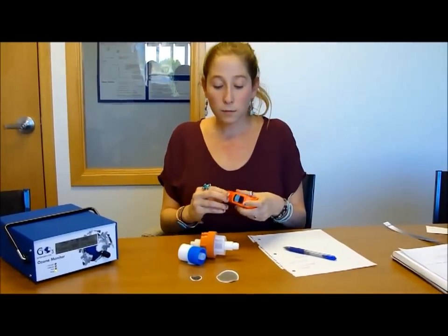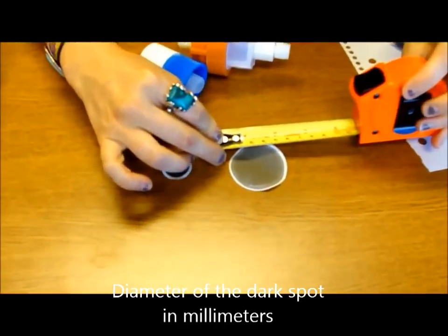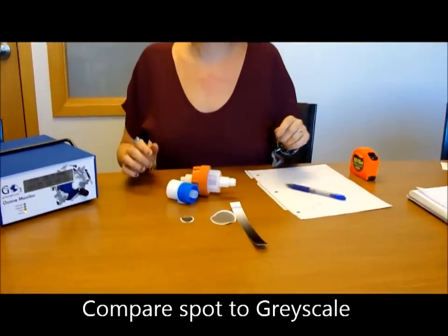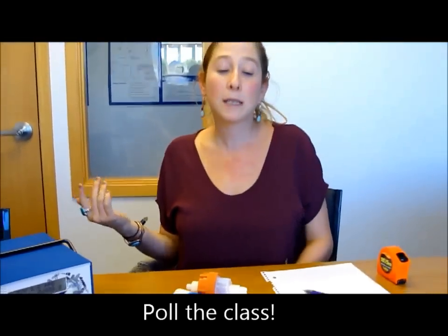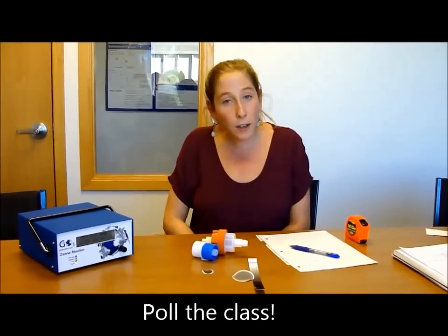You will also take the diameter of the spot, and you're going to measure that in millimeters, like so. Record that, and then the best part of all is you get to compare it to the gray scale. Now I suggest you take a poll with your class and get everybody's opinion about what the value is, and then you can take the average of those values. And now we're going to upload the data to the computer.